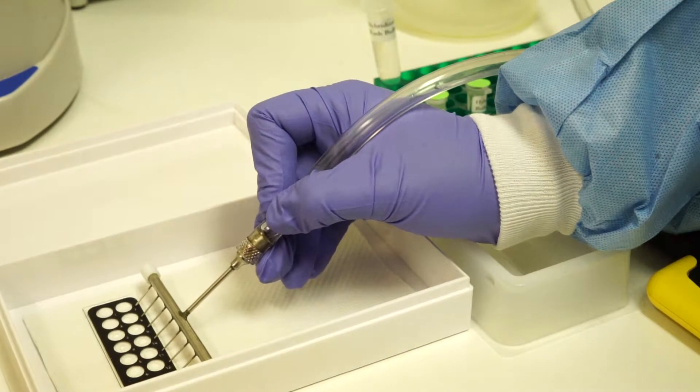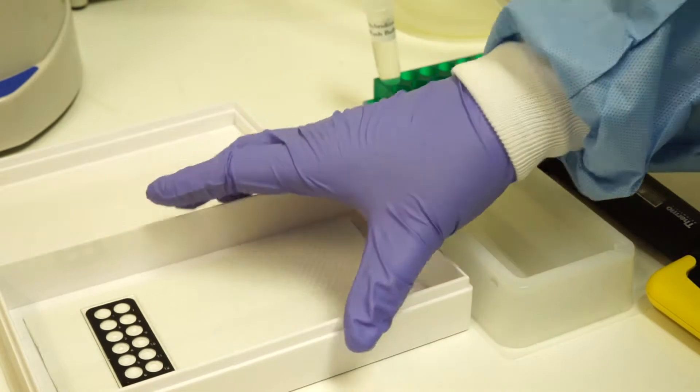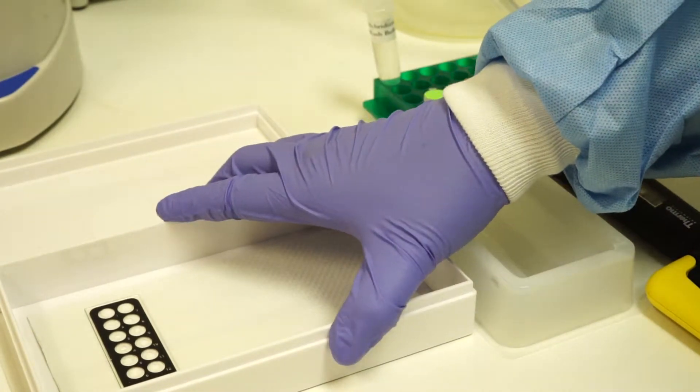After the five minute incubation, aspirate from each well. There should be a small bubble of water left, which is fine and covers the surface of the probes.